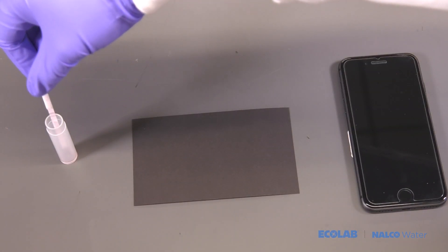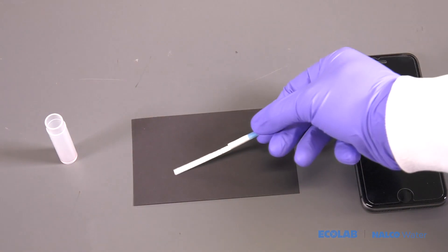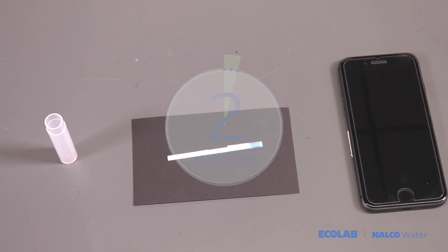Remove the test strip from the vial, placing it on the backdrop. Allow two minutes for the test strip to dry.